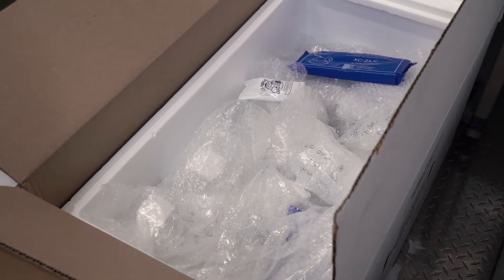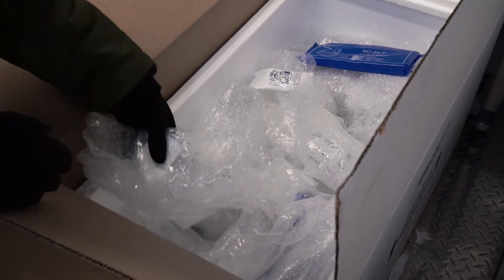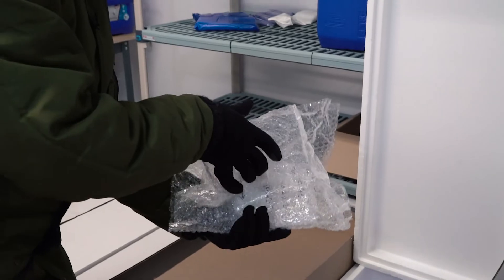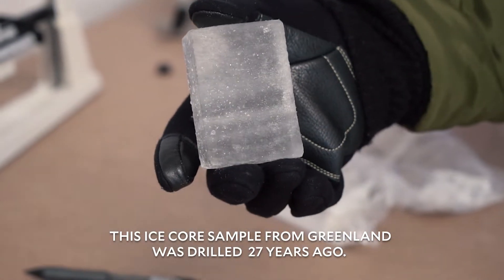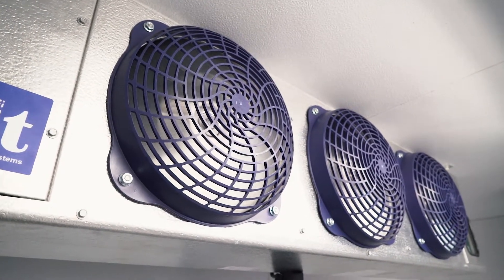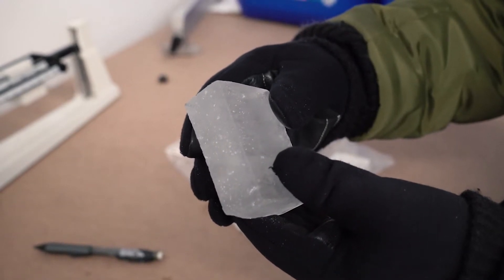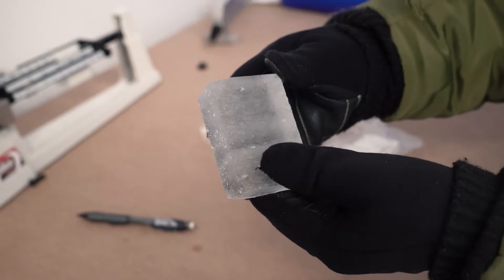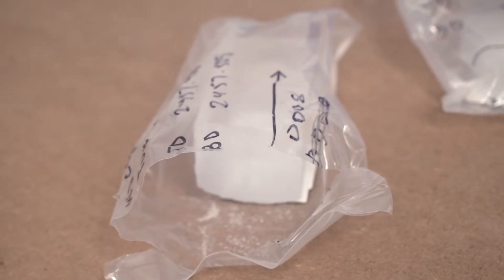This ice used to be snow that fell on Greenland something around 20,000 years ago. We're trying to preserve the ice and specifically the gases trapped in it, which means the ice has to be so cold that the gases can't leak out. That's why it's at minus 27 degrees Celsius in that freezer.